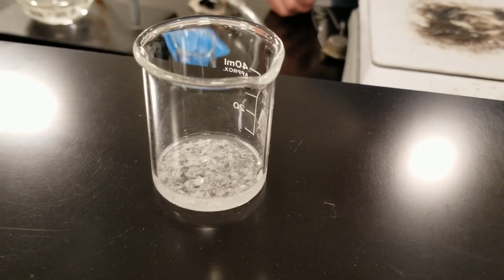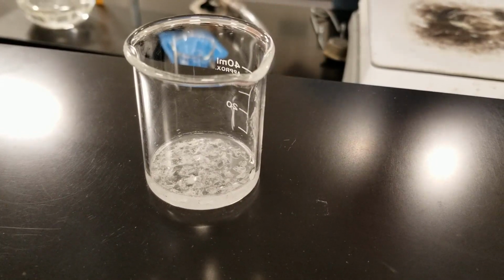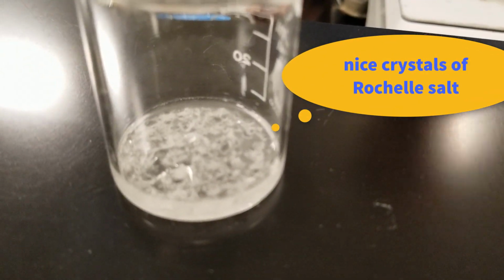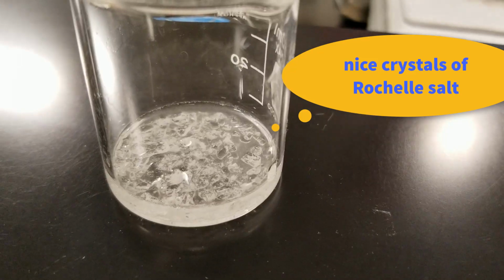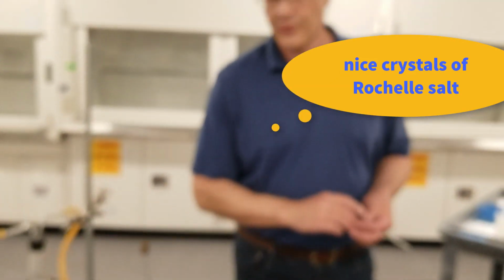Okay, and here's our product. After it's been sitting in the ice bath for some time, we start to spontaneously get crystals of the Rochelle salt. Sometimes you won't get the crystals spontaneously. Sometimes you have to put in a teeny little crystal of Rochelle salt from somebody else's prep to get the ball rolling, and then it crystallizes quite rapidly.